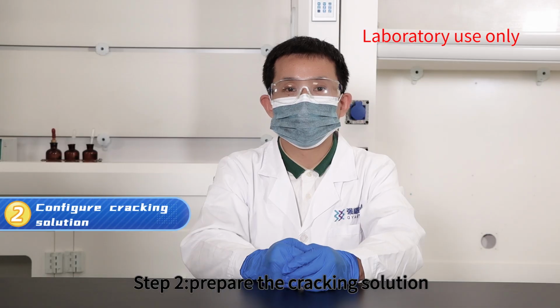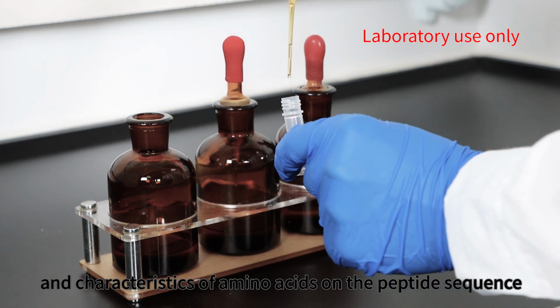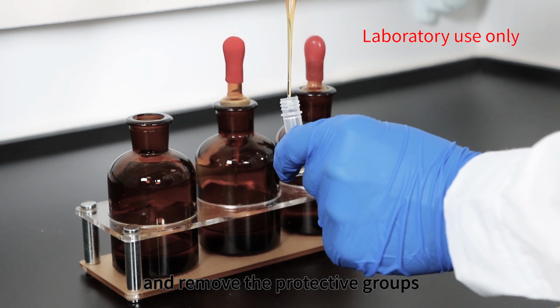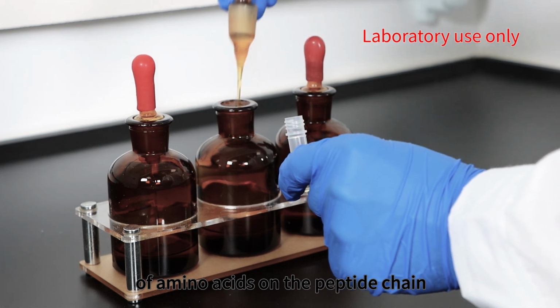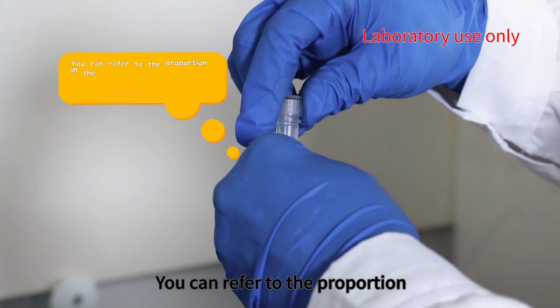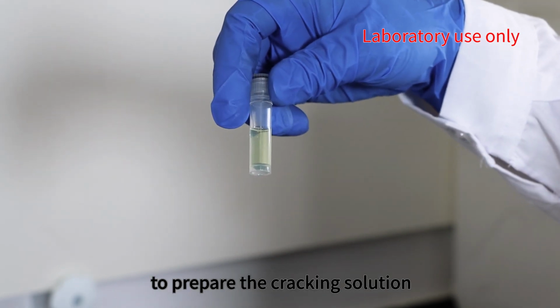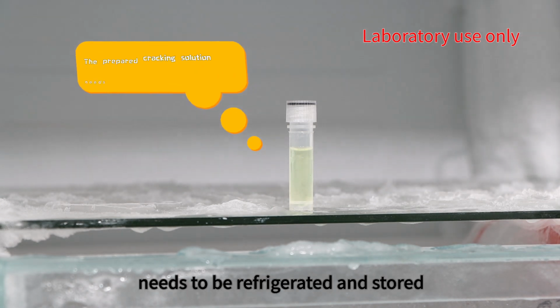Step 2. Prepare the cracking solution. Select the appropriate lysis buffer based on the differences and characteristics of the amino acids in the peptide sequence, and remove the protective groups of the amino acids on the peptide chain. You can refer to the proportions in the composition table of the cracking solution to prepare it. The prepared cracking solution needs to be refrigerated and stored.